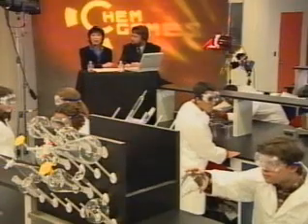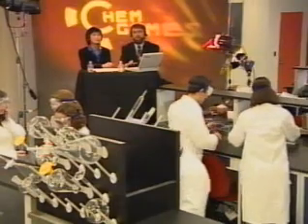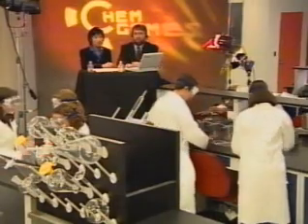You see that a lot, Mia. You'll see someone take all the necessary precautions, but an accident still happens. Then what? I'll tell you what. You have to know what to do. Well, the action has begun, and as it does, there is activity everywhere. Yeah, and at a time like this, you can tell that these kids have really done their homework.